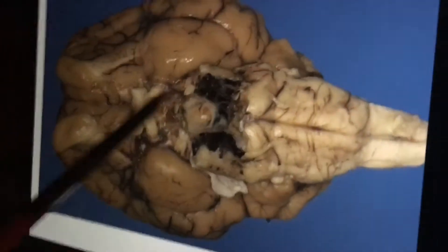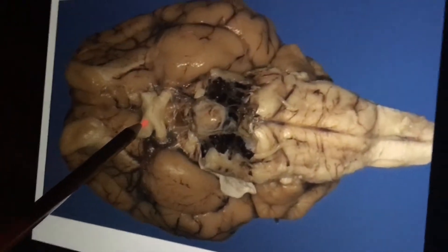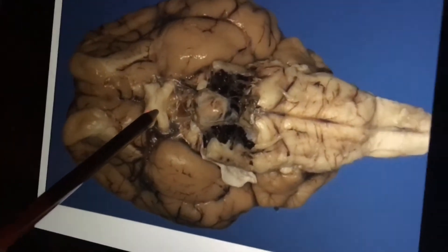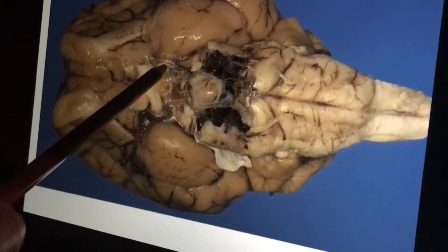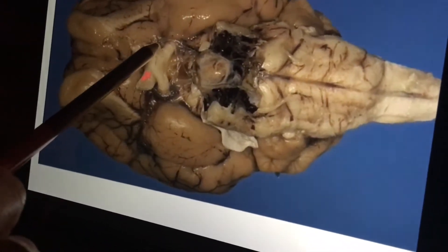This over here is the optic chiasma, the optic nerve, the optic tract.